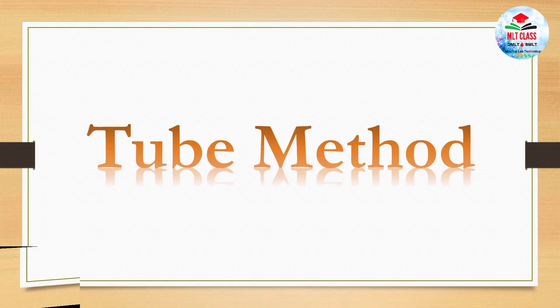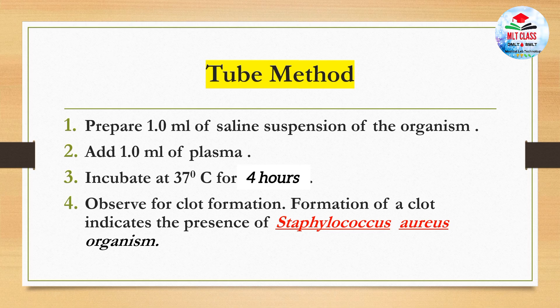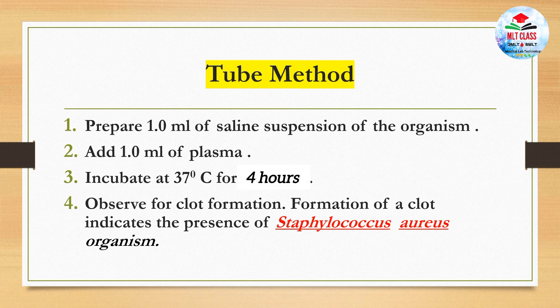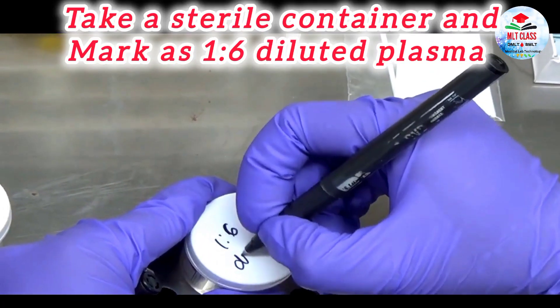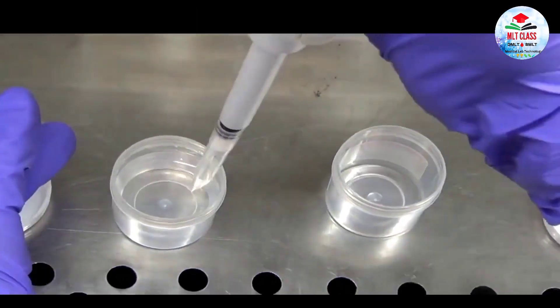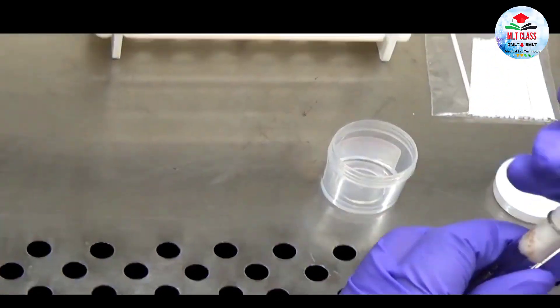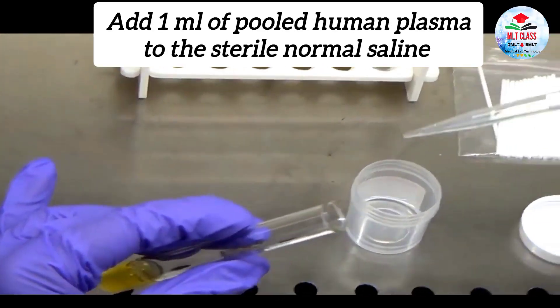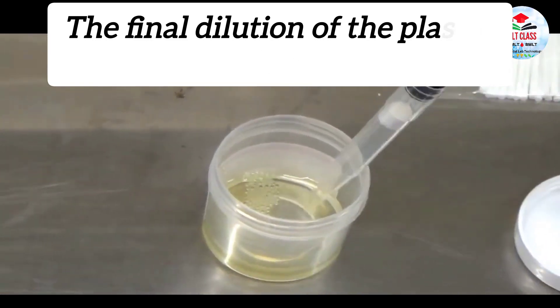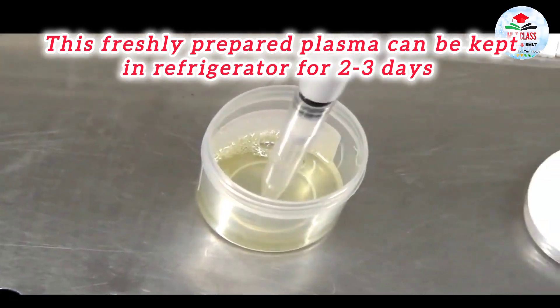Now we will see the tube method. First, prepare the diluted plasma by taking a sterile container marked as 1-in-6 diluted plasma. Add 5 ml of sterile normal saline to the container, then add 1 ml of pooled human plasma to make a final dilution of 1 in 6. This freshly prepared plasma can be kept in the refrigerator for 2 to 3 days.